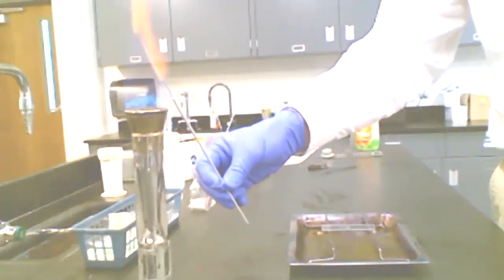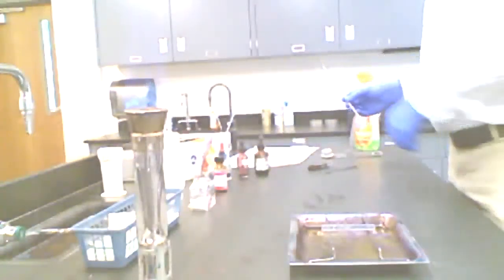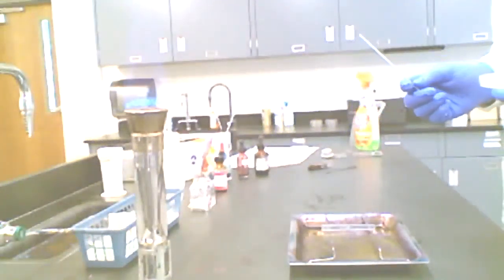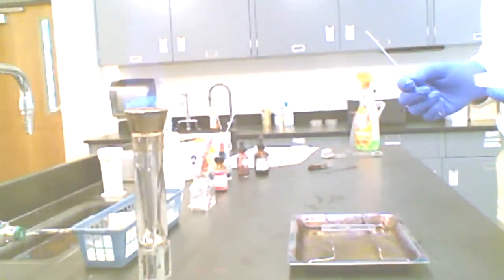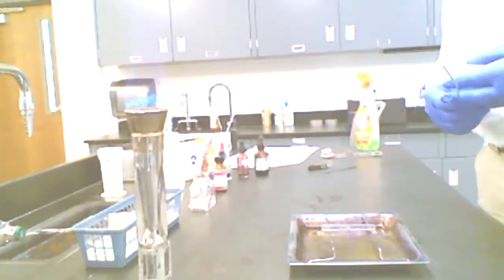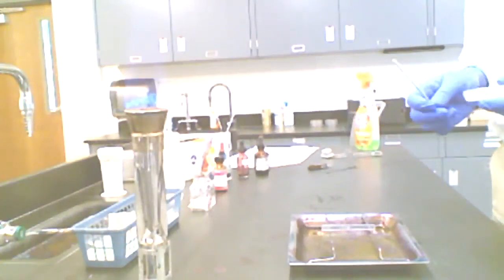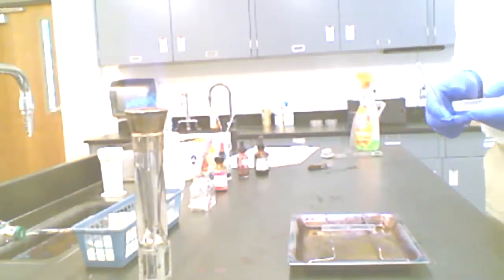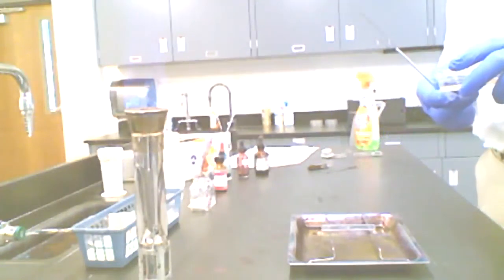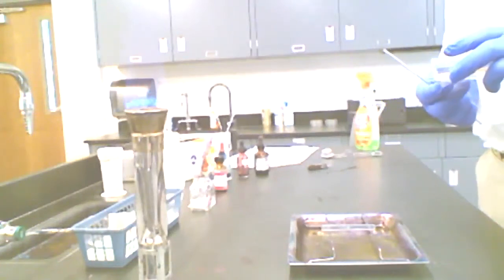It is very much important to note, and Dr. Ashball will probably go into some detail about this too, or remind you, that when you're making these slides, you want less water than you would imagine. The more water that goes onto the slide, the longer it is going to take for the slide to dry. And then that's going to increase your time in lab. This is microbiology, micro, small, so a little goes a long way here. The width of that little drop on that slide is probably maybe 0.5 to 0.7 centimeters or so. Not even the width of an aspirin tablet, maybe even half that actually.